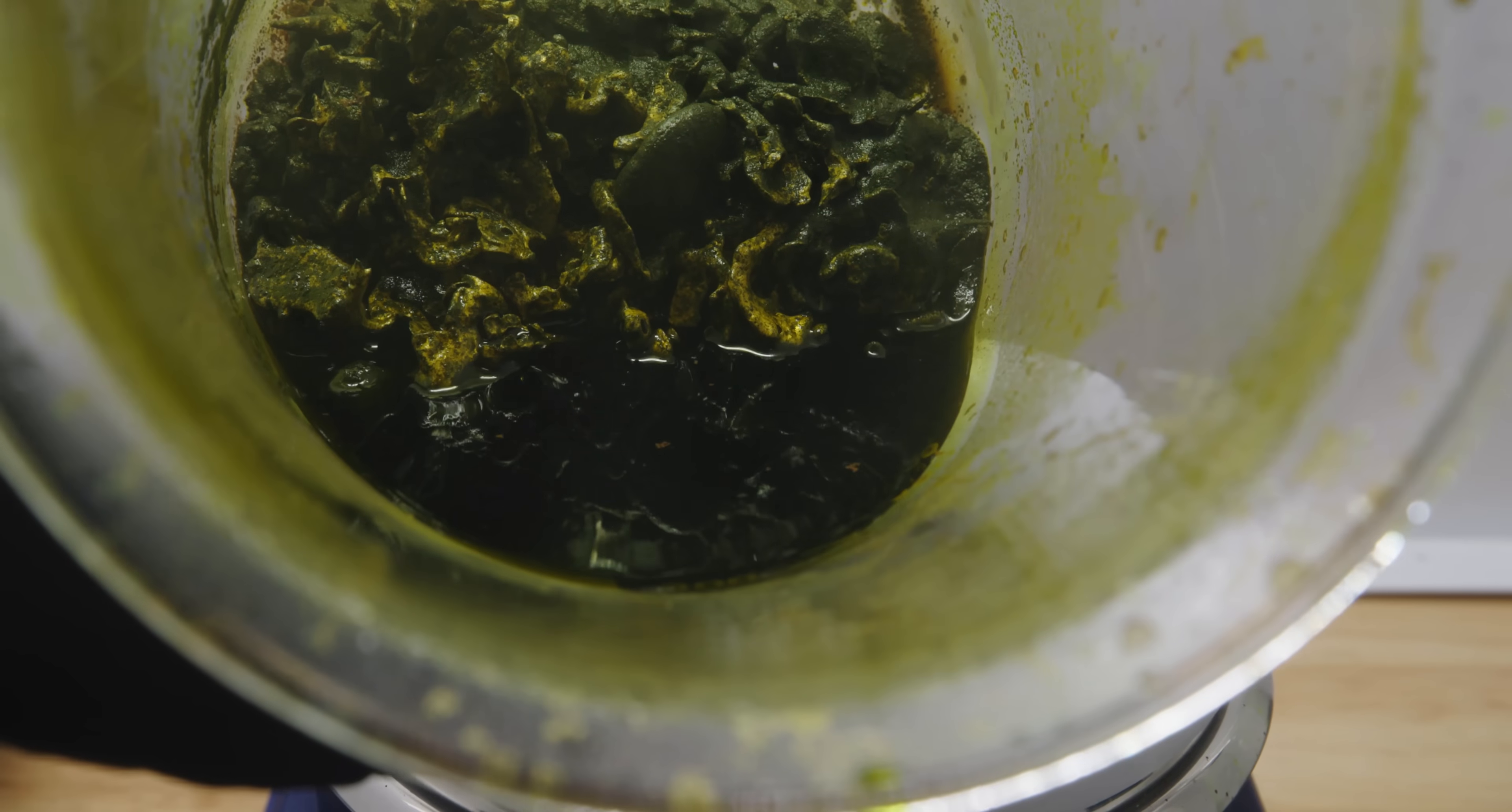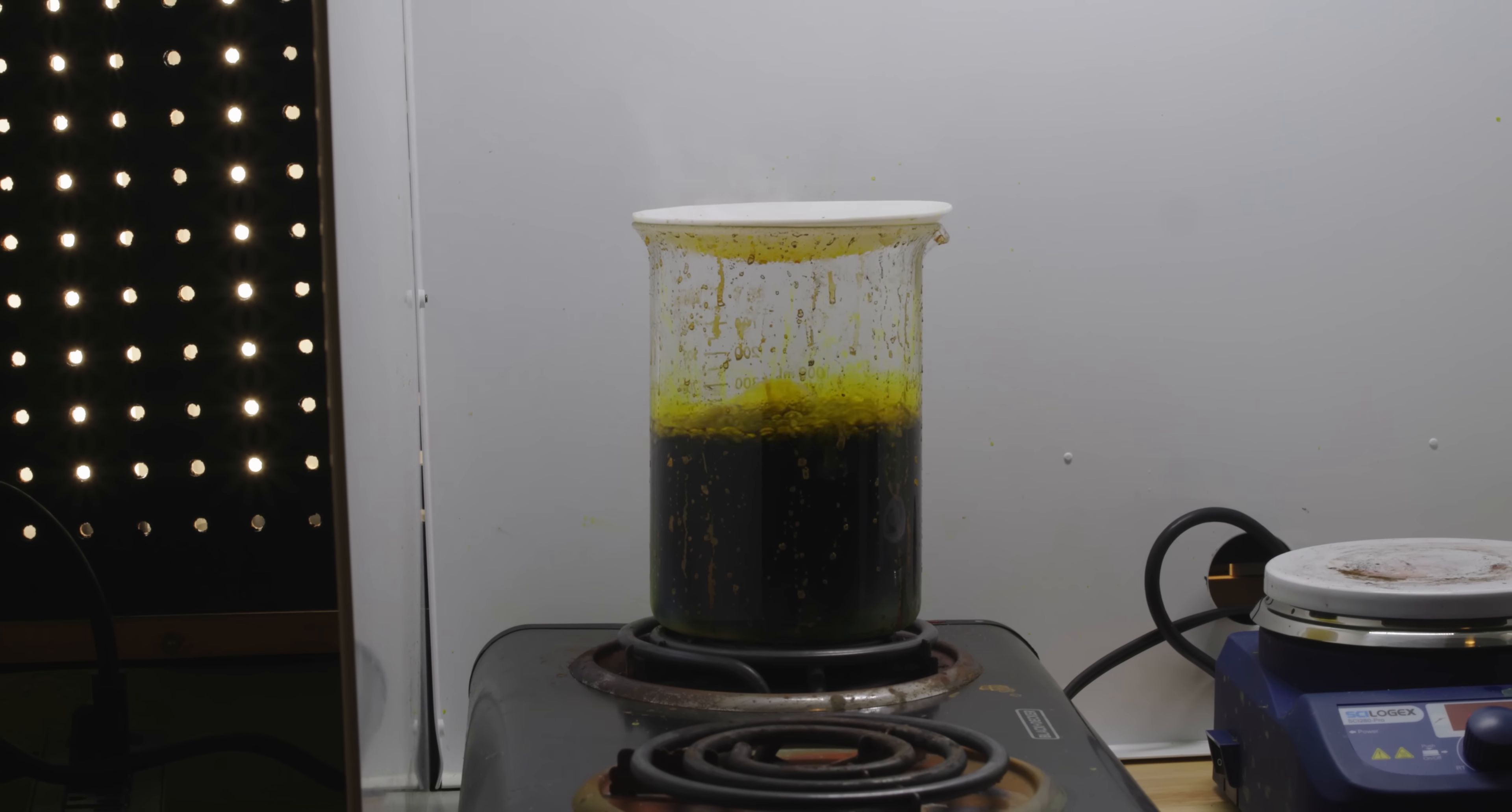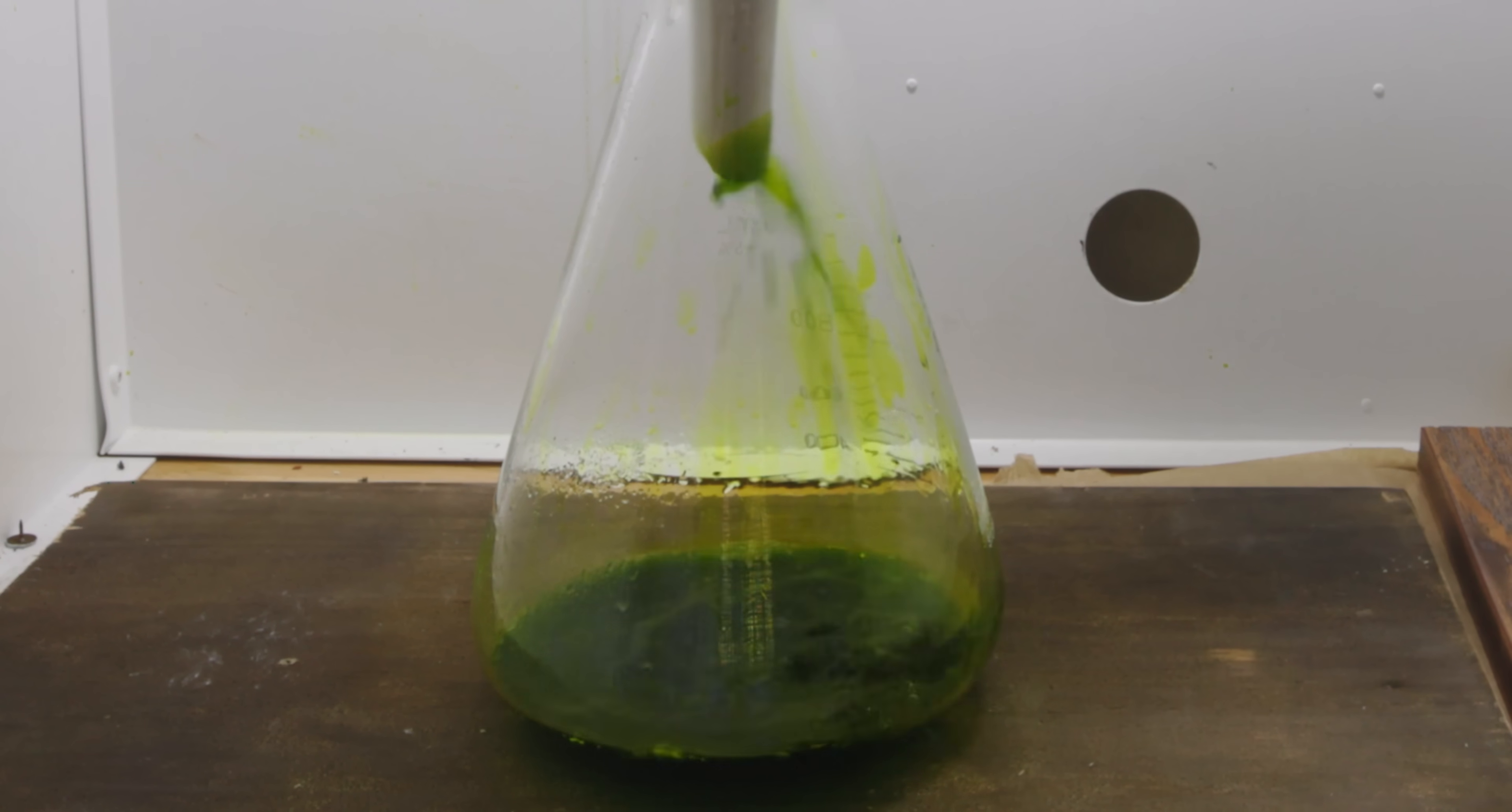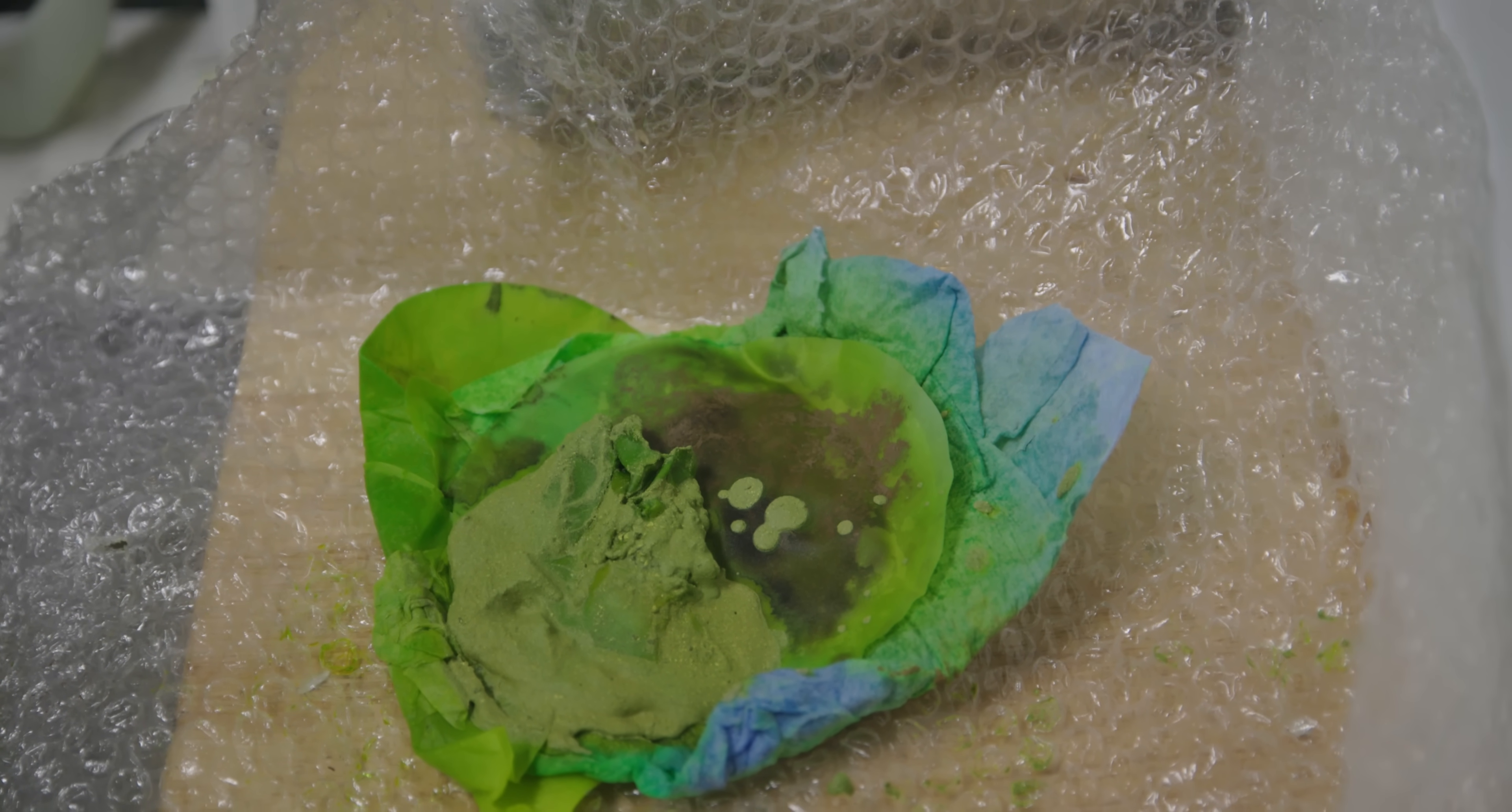There's just a little bit left. I'm going to do this one last time. Using a stir rod and swirling around the beaker and not having much resistance was truly a wonderful feeling. All of the metal has been dissolved and it's time to move to the next step which is separating the liquid from the silver chloride and I do this by pouring everything over a filter again. As you know I had to dissolve all this metal in multiple attempts so I have lots of different beakers filled with dissolved metal and I will pour them all individually through this filter capturing as much silver chloride as I can. Now there's actually a way to save all this silver chloride and refine it and turn it back into pure silver but that's going to be maybe for another video. We're only really concerned about gold in this video.